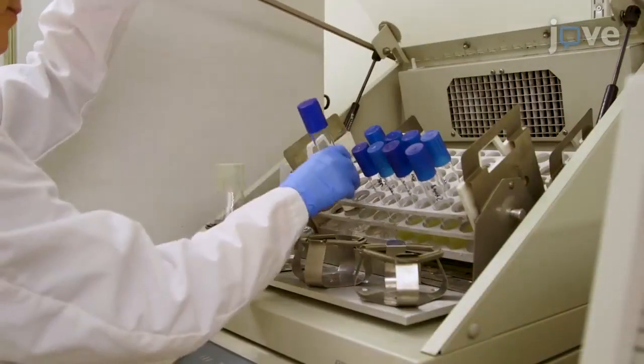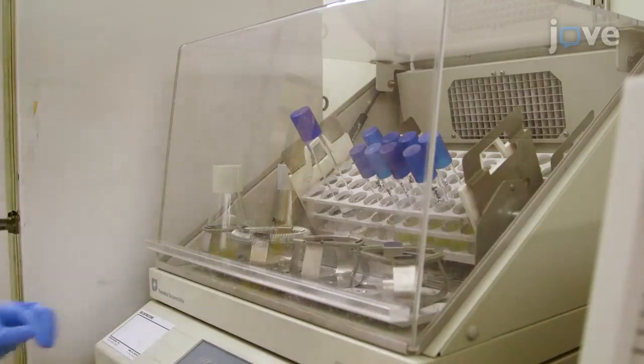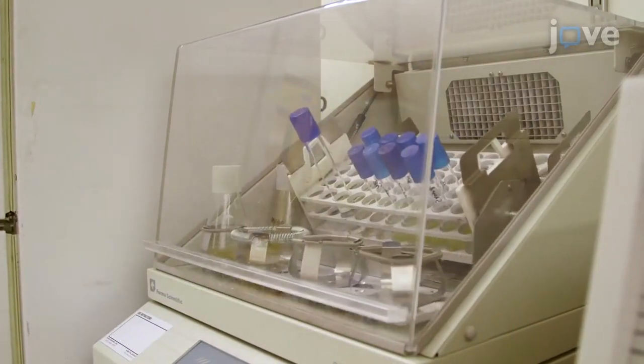First, grow an E. coli culture in M9 minimal medium overnight at 37 degrees Celsius.